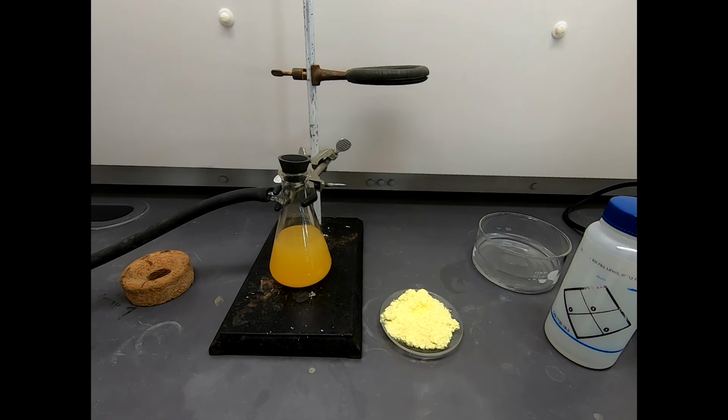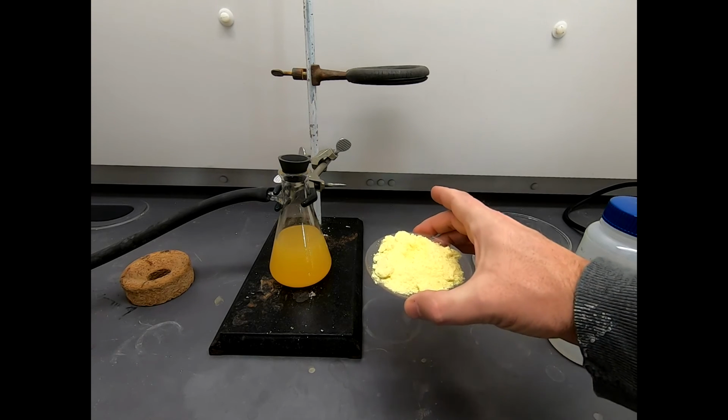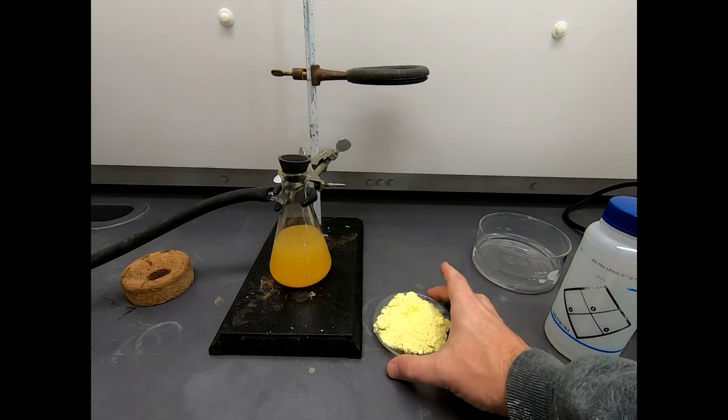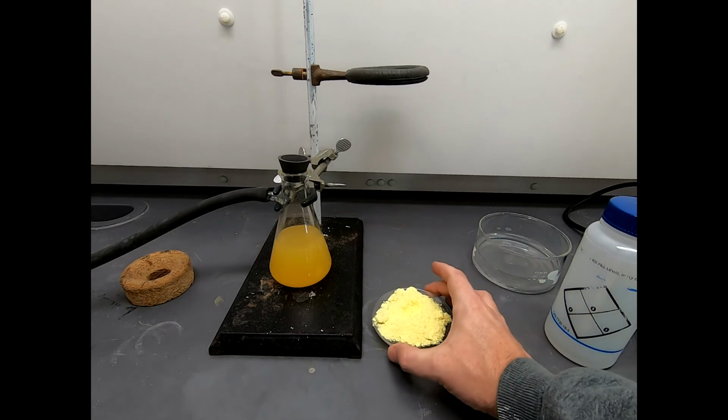Okay, well now the solid has been spread out on a watch glass. I say spread out. I really should have used a larger watch glass to give it more of a spread, but that's what I used. I under-anticipated how much solid would be formed. There's a big hole in the middle. That's where I removed the stir bar. I'm not sure how well it comes out on camera.